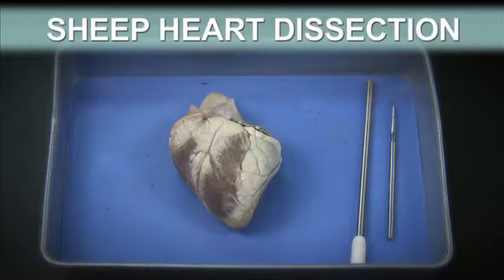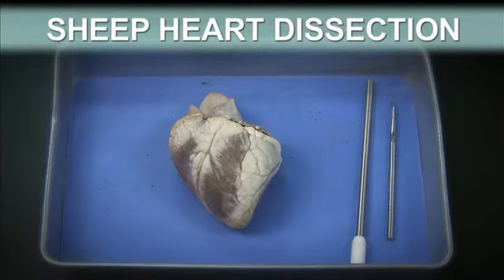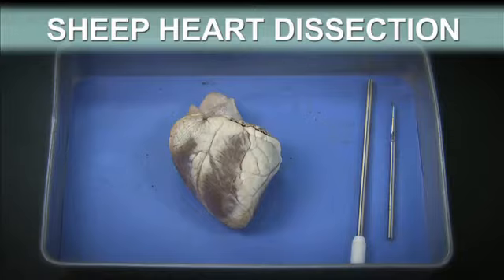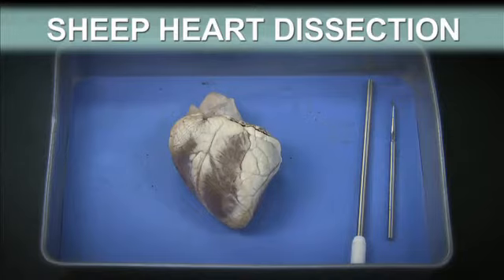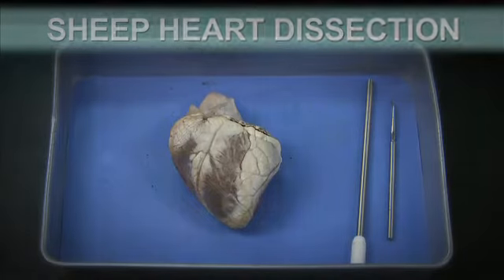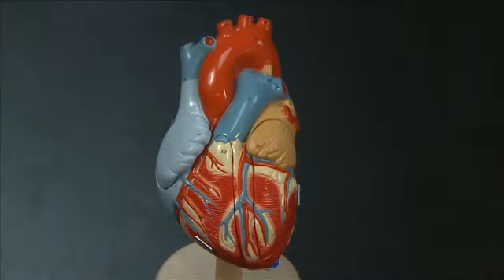In this demonstration, we'll guide you through the dissection of a sheep heart. It's going to be helpful to first visualize these structures on the model of a human heart.